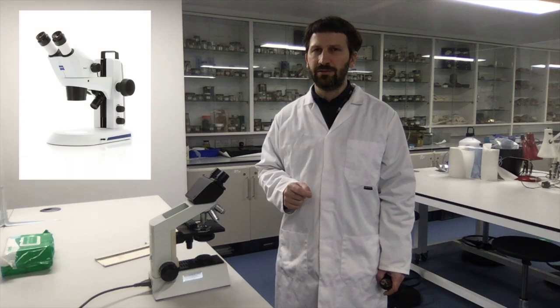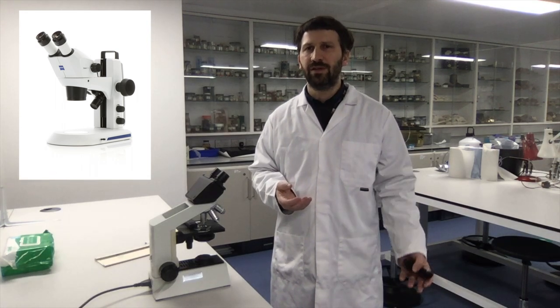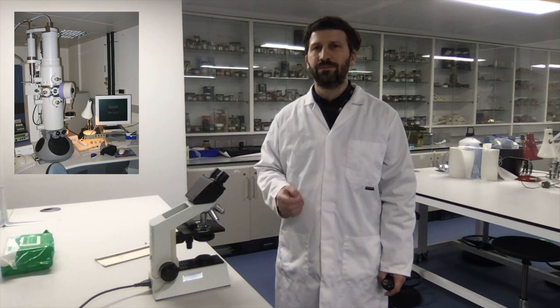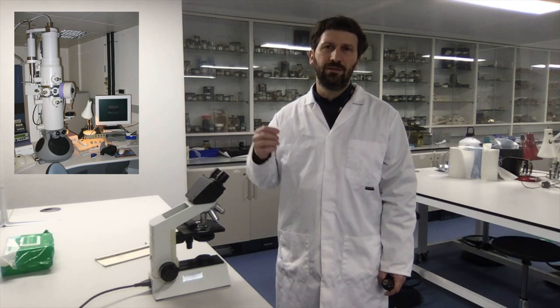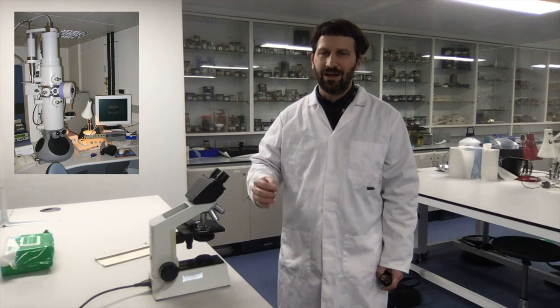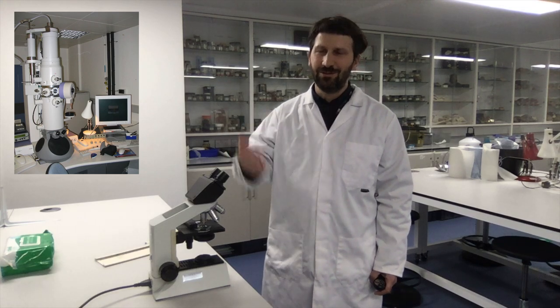There are also other types of microscopes — for instance the stereomicroscope, which you may use if you want to observe slightly larger objects, for instance insects or some other small invertebrates. And then there is the electron microscope that reaches a resolution of about the size of an atom, on the order of 1 Ångström, where there are 10 Ångströms in 1 nanometer, 1000 nanometers in 1 micrometer, 1000 micrometers in 1 mm, and 1000 millimeters in 1 meter.